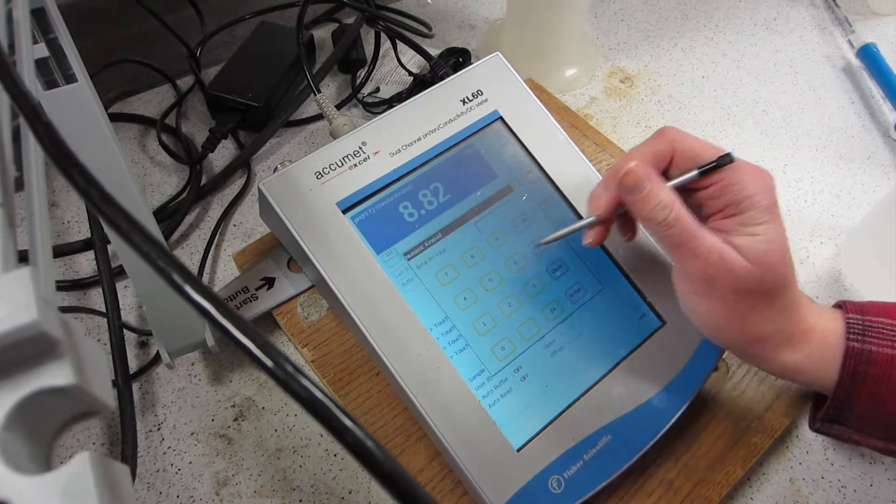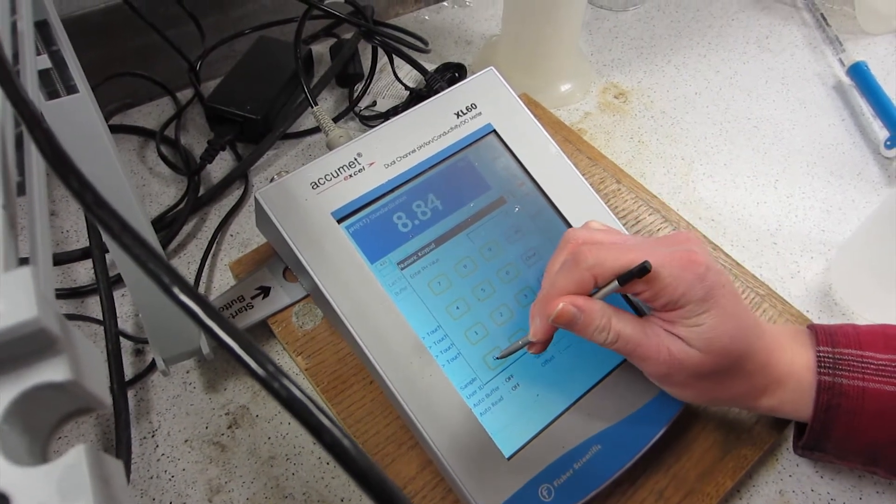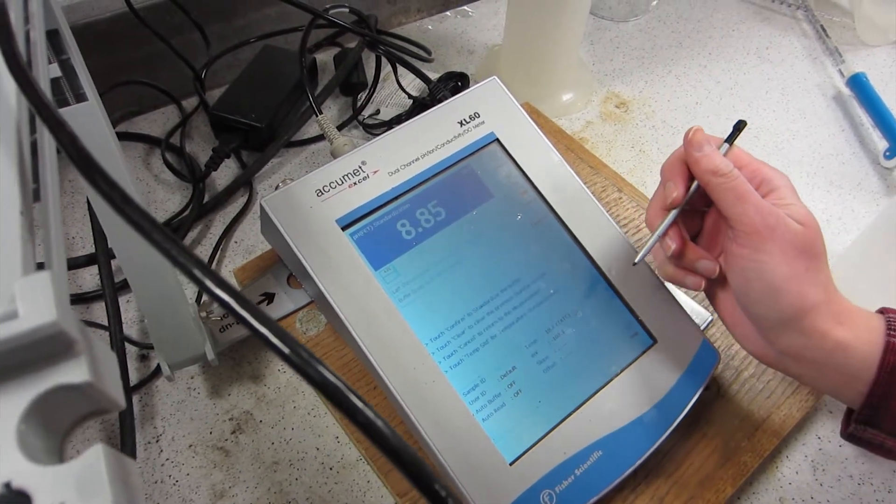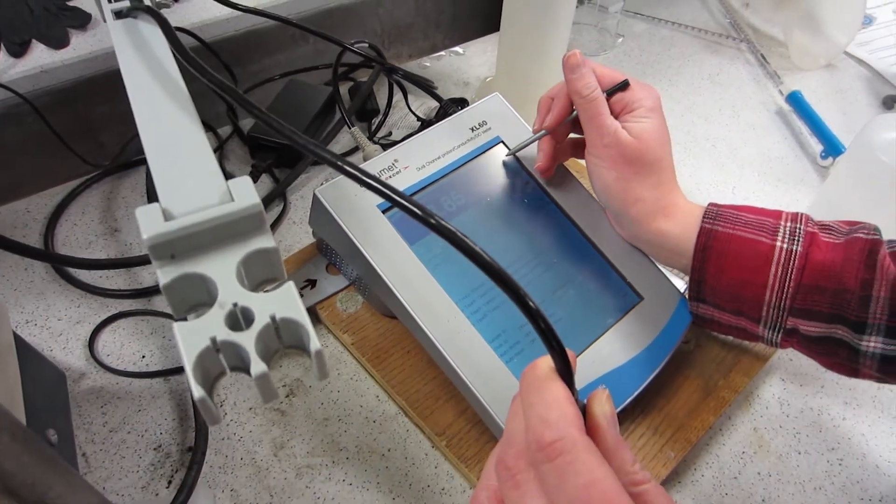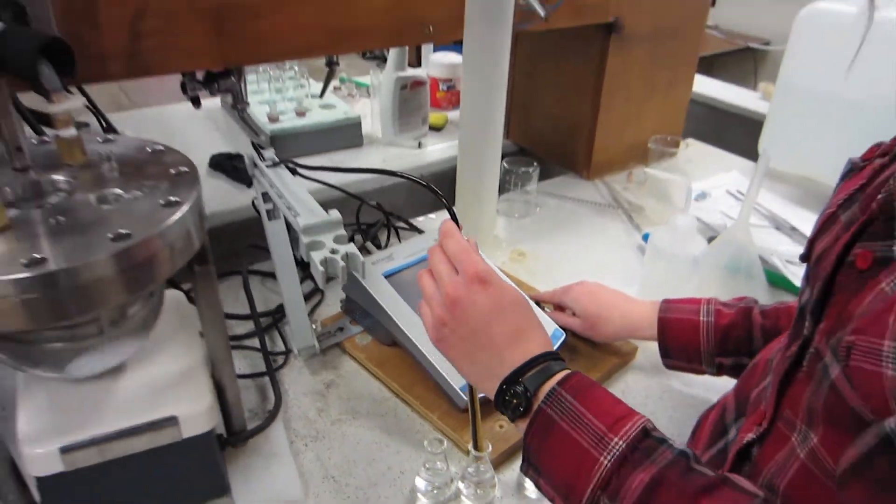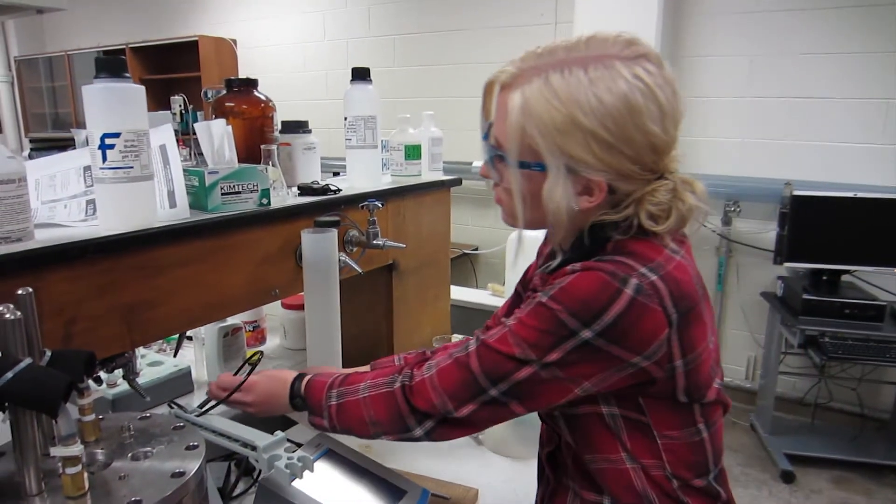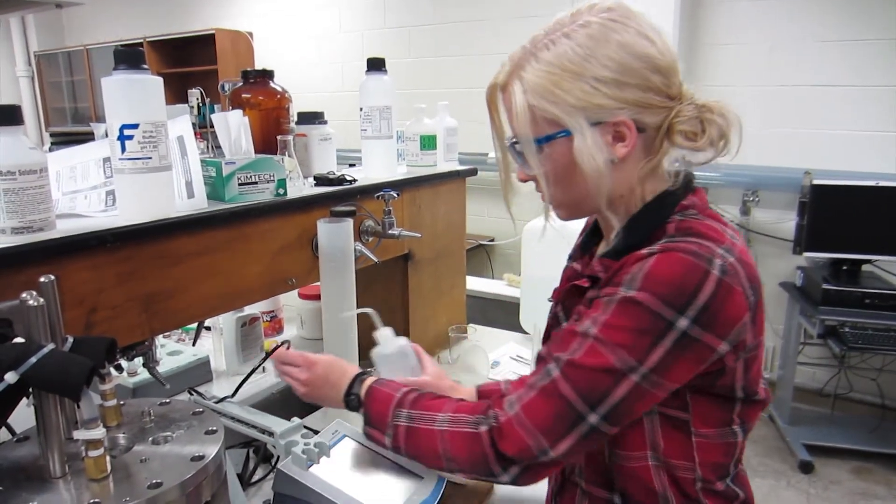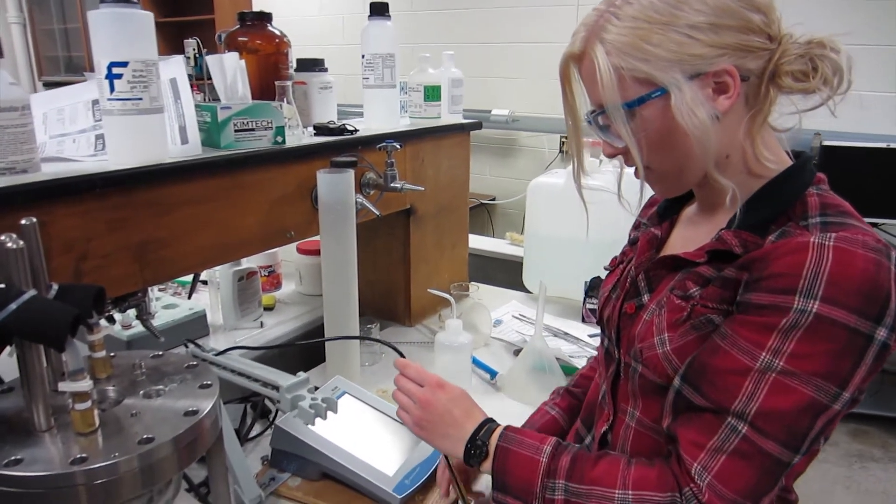Sorry, I think this is 7. Hit standardize, wait until it blinks at you.